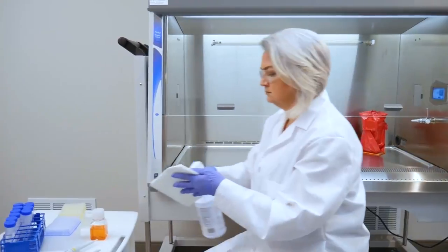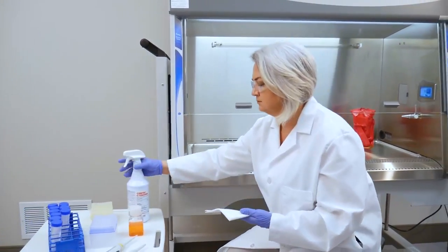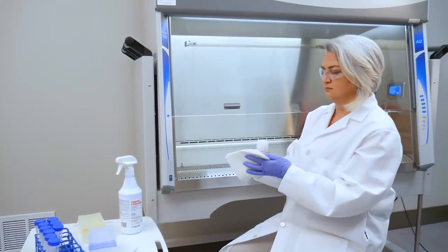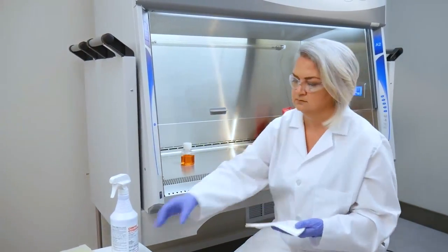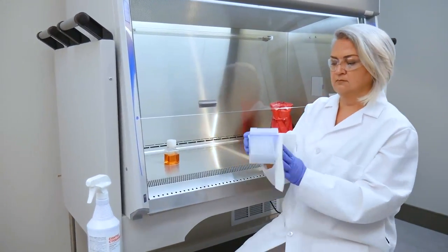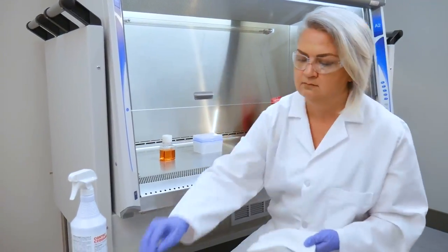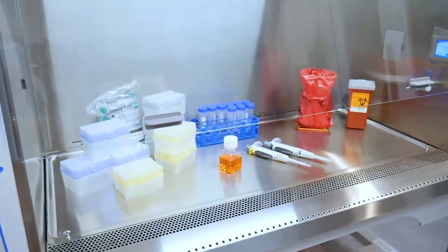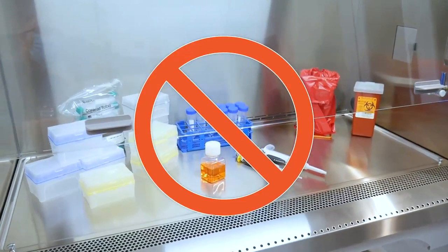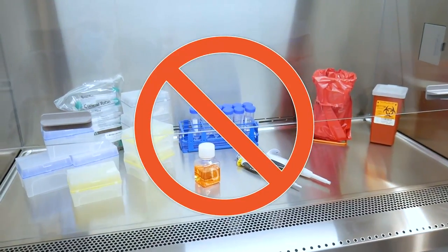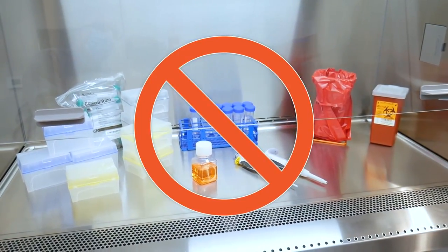With the BSC prepared for work, you can now place your equipment and samples into the cabinet. Wipe down all materials brought into the BSC with a suitable disinfectant and set up work in an aseptic flow from clean to dirty. Only place your required materials within the cabinet. Overloading may disrupt the cabinet's airflow and create unsafe conditions.